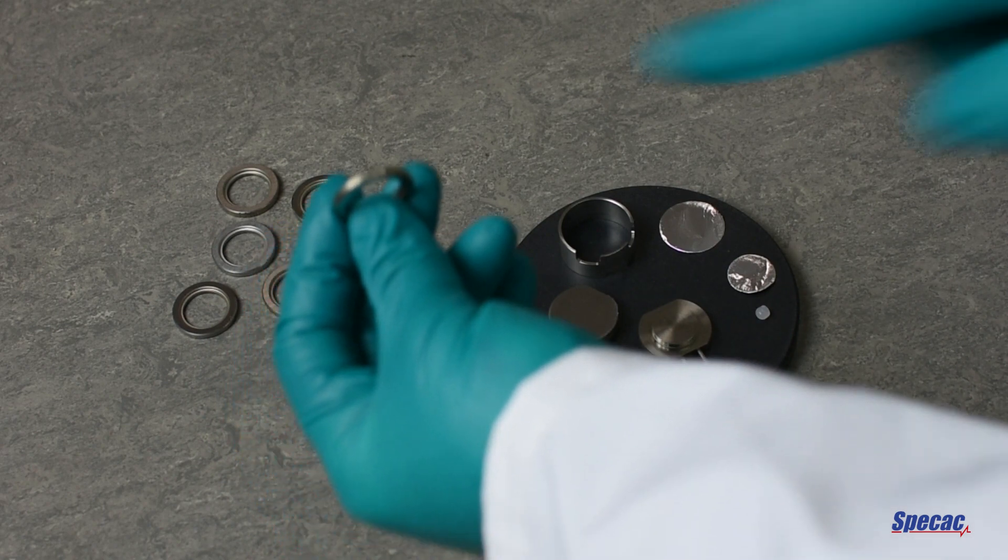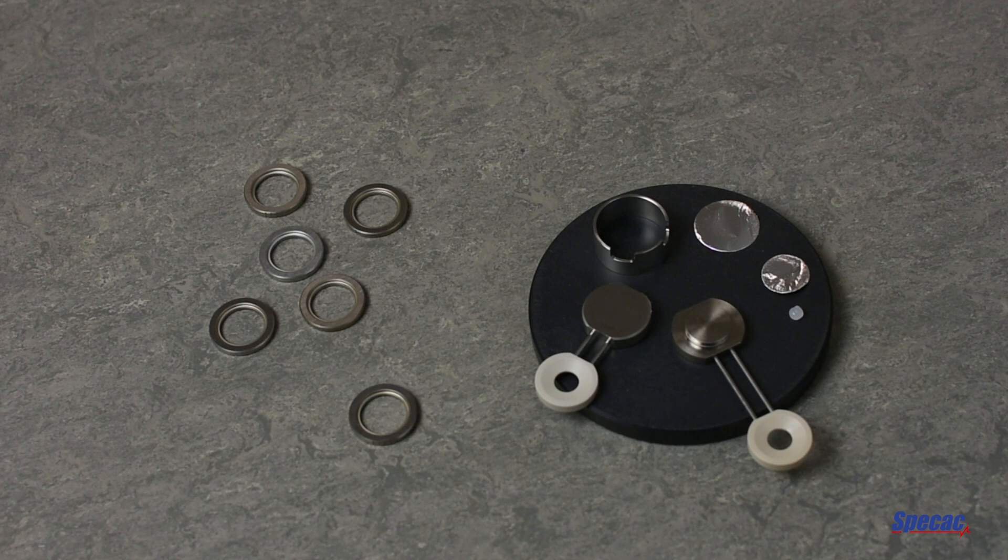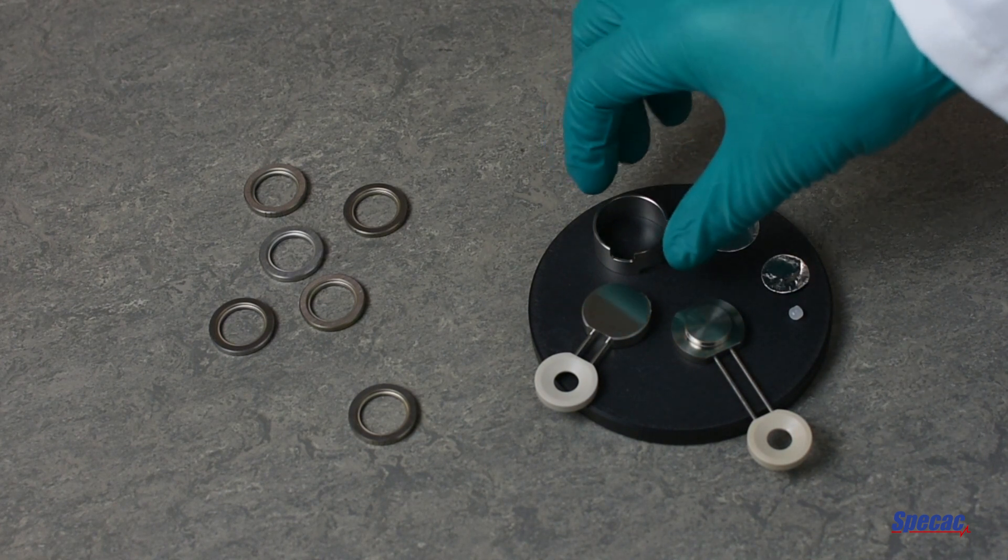Each sizing ring has a series of marks along one edge that indicates how thick it is and the meaning of the marks can be inferred from the manual. The first step is to place the shield over the lower plate.